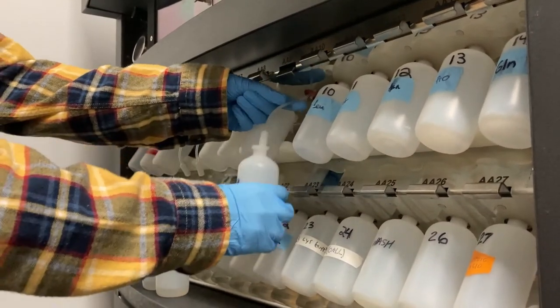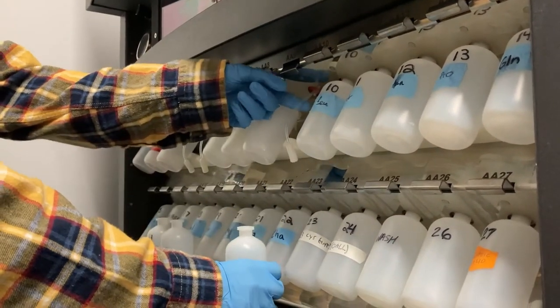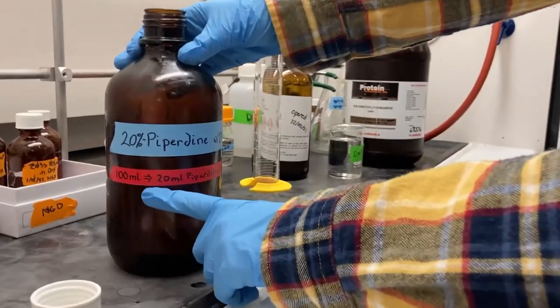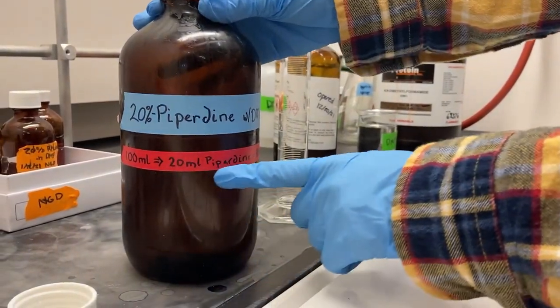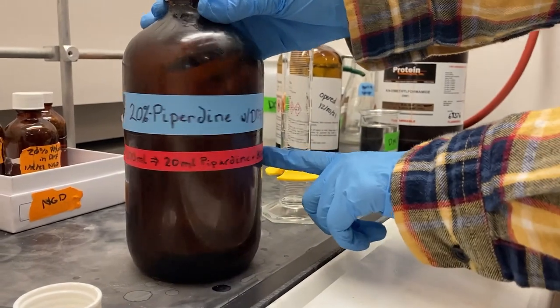Remove the amino acid bottles you need to fill by pressing on the metal tab until the bottle releases. You will notice as you fill the reagent bottles that the instructions to make the most commonly used amounts are written on the bottle label.